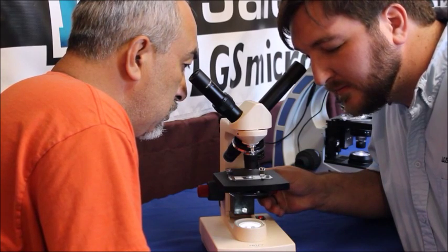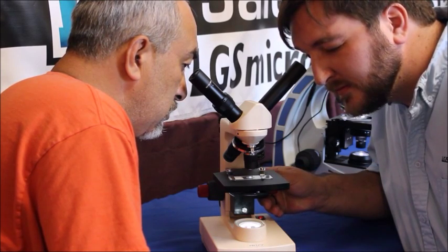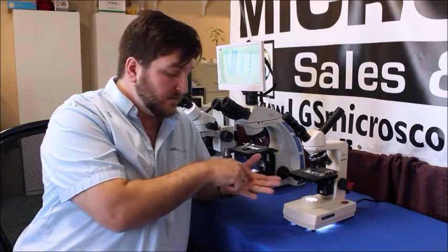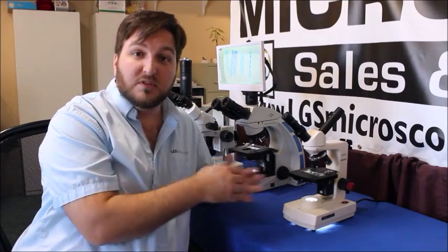This is great for teaching or if you're splitting a microscope between two separate students. Sometimes there will even be a pointer in the eyepieces so that you can point at a specific feature and then you'll both know what you're talking about.